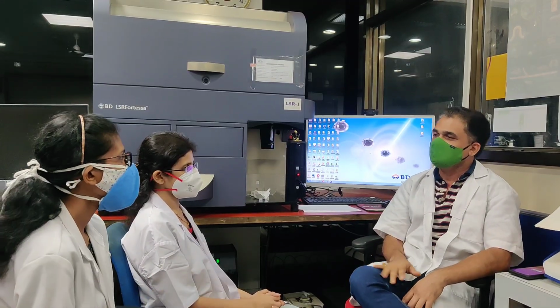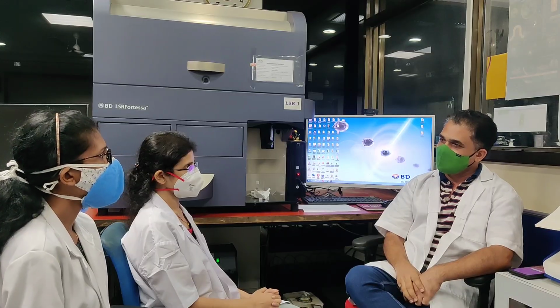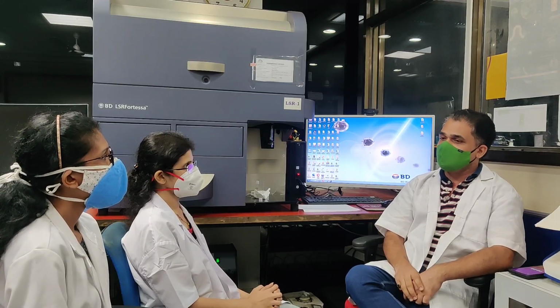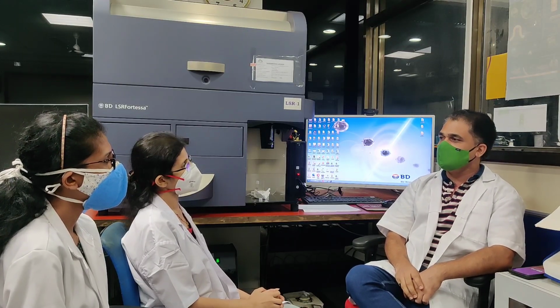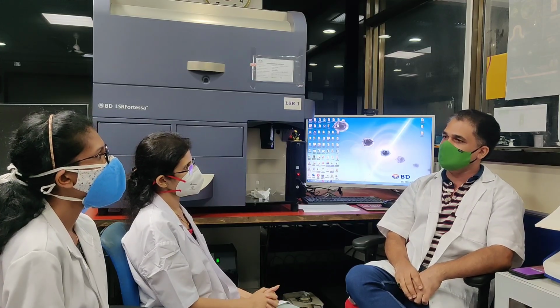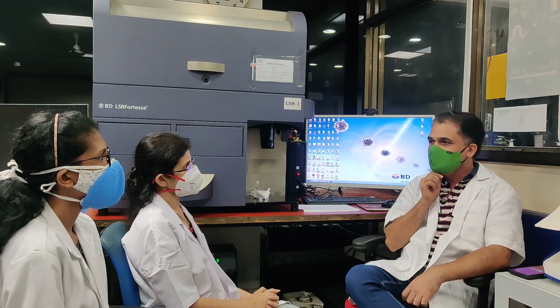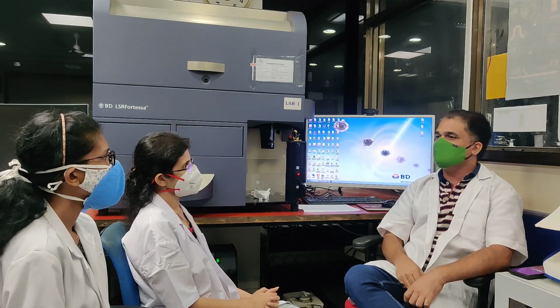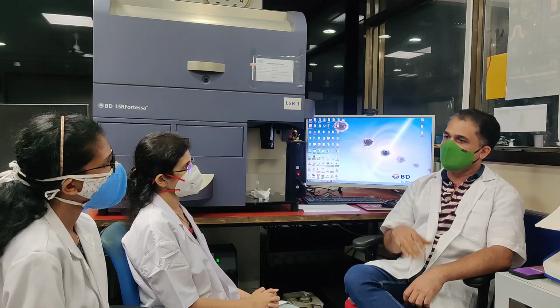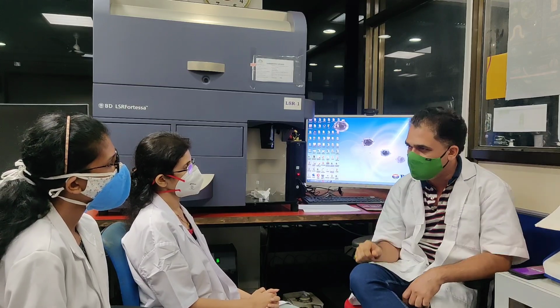Sir, I have a question. Why are we not adding 7AAD in Stemtrol? Well, it's a good question. If you add 7AAD to a preserved sample like the Stemtrol control as well as UK NEQAS and the CAP sample, you are going to lose the population of interest where your CD34 events come in the picture, if you remove on the basis of viability.